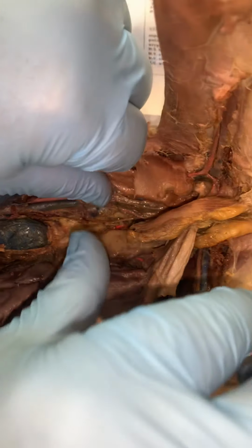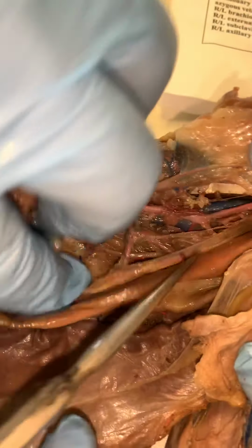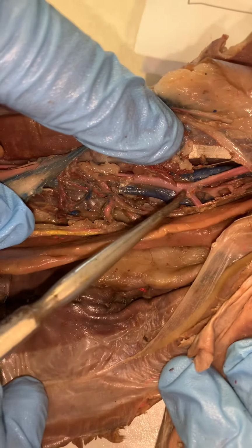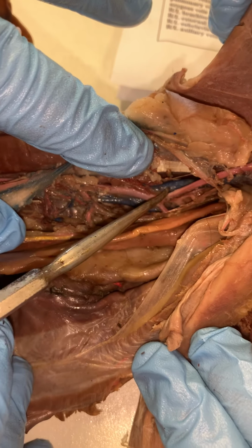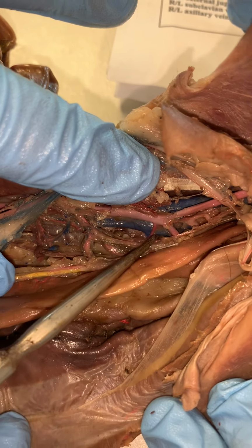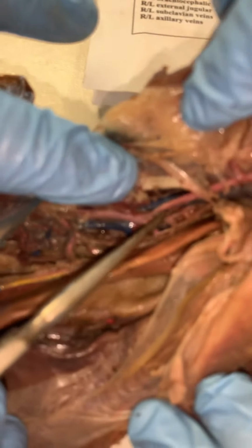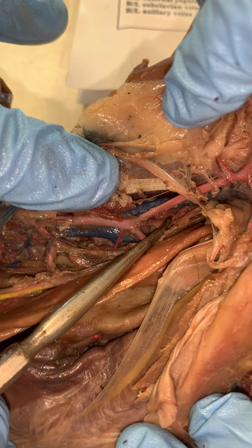The same thing is going to hold true when we look down here to the lower extremity. Here's the inferior vena cava right here. Now it's going to split ever so quickly into a right and left common iliac vein, and there is an internal iliac vein that I'm not able to find coming off about in this position here where the probe is, going down and draining those deep reproductive and urinary structures.